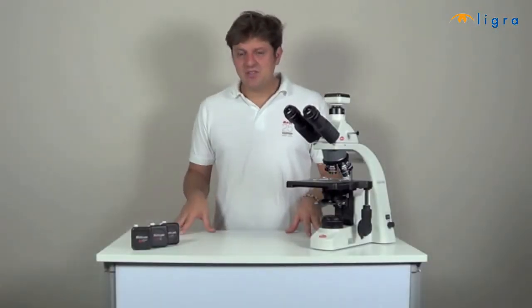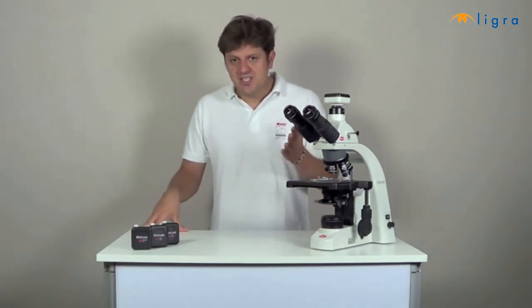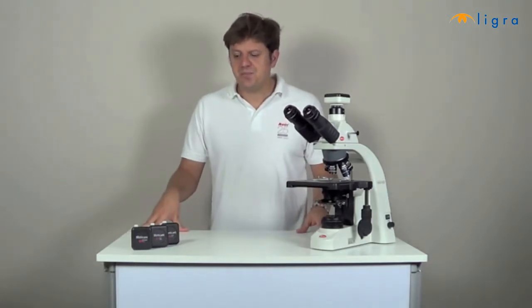Motic standard live resolution cameras are introduction models in digital microscopy. They have a good quality sensor and are frequently used in education and small laboratories. Moticam 1 has a resolution of 800 by 600 pixels. It is a rather small image format, good for basic displaying of the image without need to zoom into details.